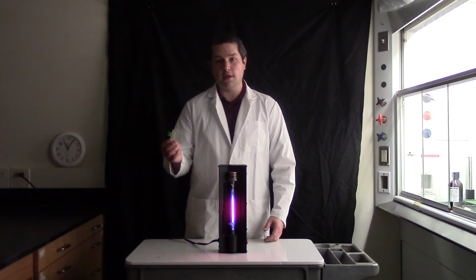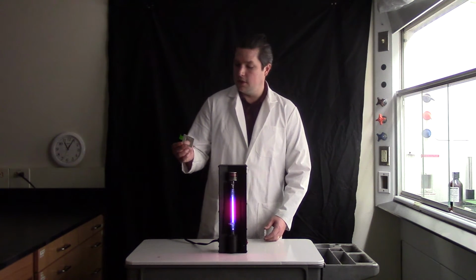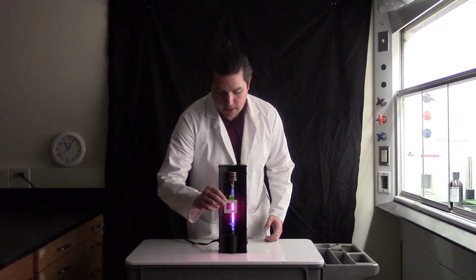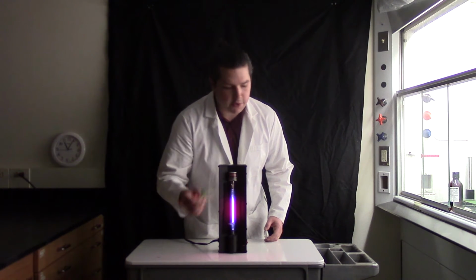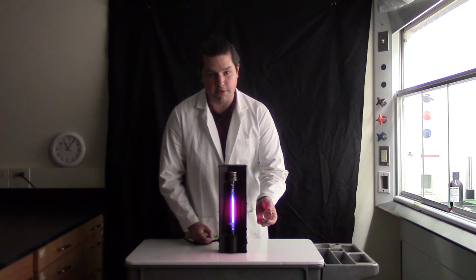Diffraction gratings work a lot like prisms in that they separate light out into its component wavelengths. By placing the diffraction grating between the light source and the camera, it will separate out the light to reveal the spectral lines. Rather than doing this with this small grating here, I have a camera lens that fits onto the camera, so we can do this with a little bit higher resolution.